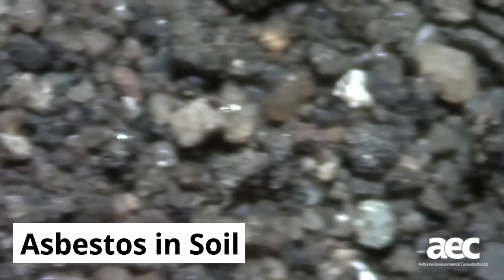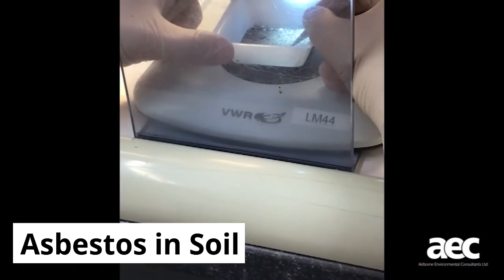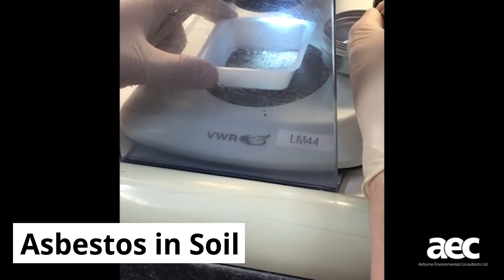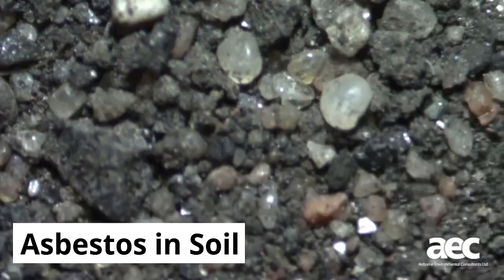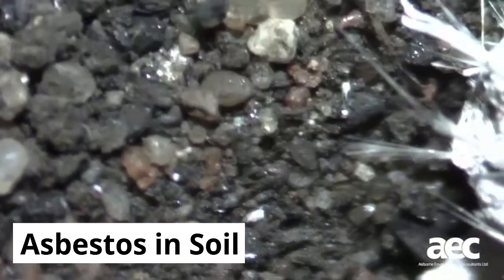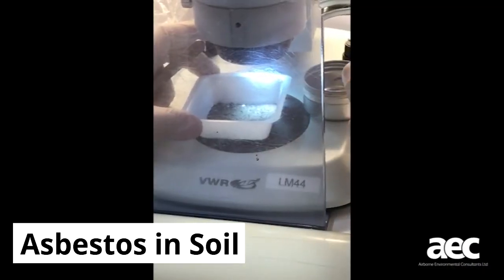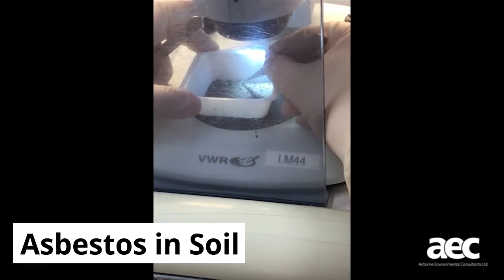These include an assessment for the presence of asbestos-containing materials, known as Stage 1 analysis, a quantification of the amount of asbestos-containing materials within soils, known as Stage 2 analysis, and finally, a full assessment of the amount of asbestos within soils, which is known as Stage 3 analysis. This stage includes the analysis done in Stage 2, but additionally identifies fibres that may be loose in the soil and are microscopic in size.